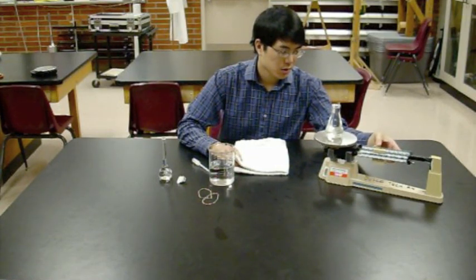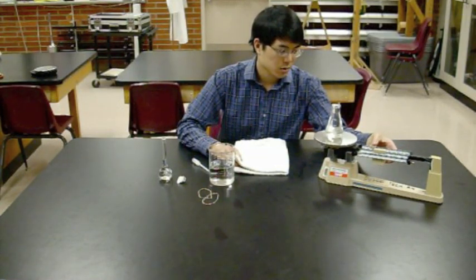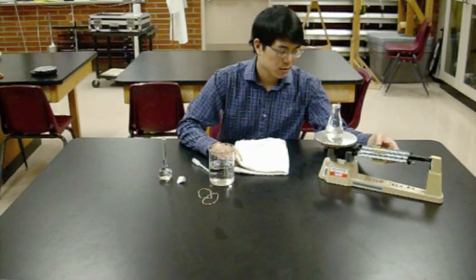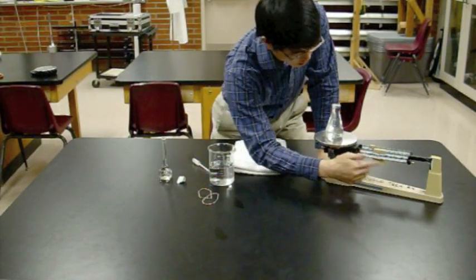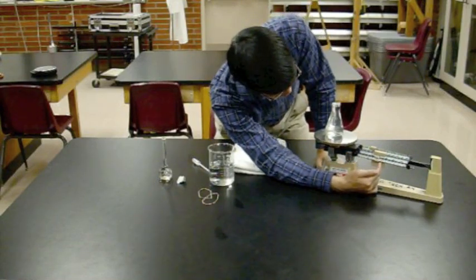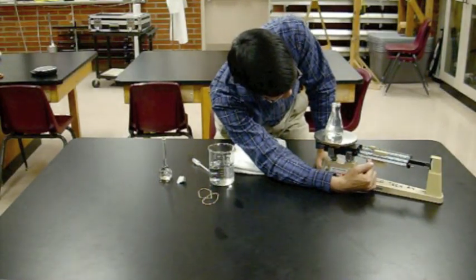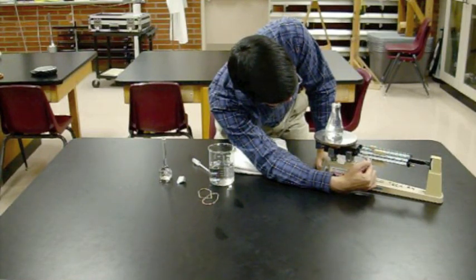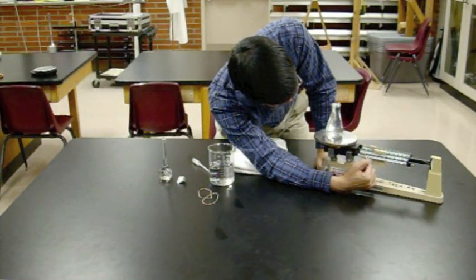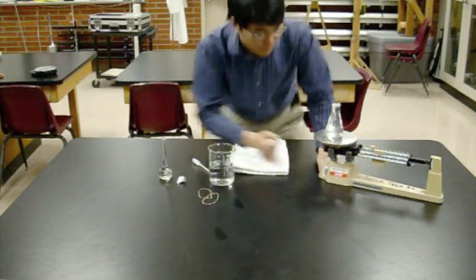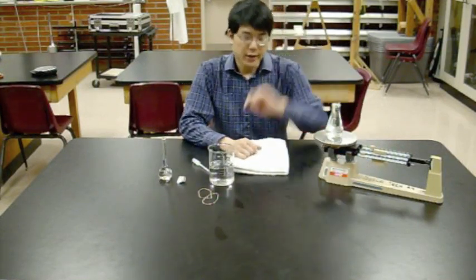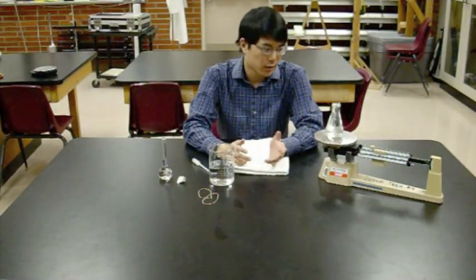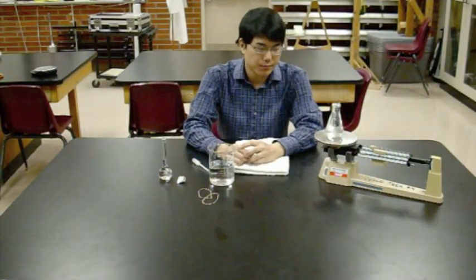That's still too much. That's still too much. That's not enough. So that's the position we want to be at. There you go. Add those masses together. Should be over 200. How much over 200? Varies a little bit depending on your Erlenmeyer flask.